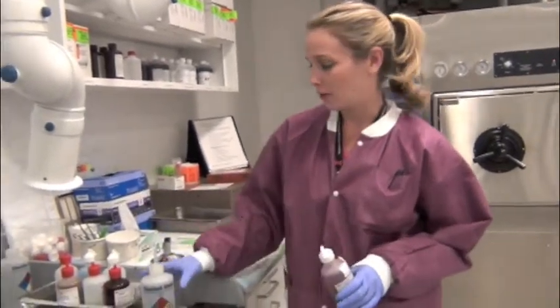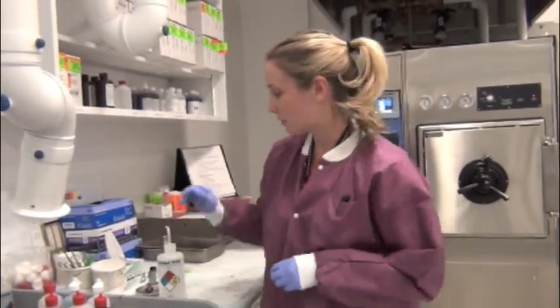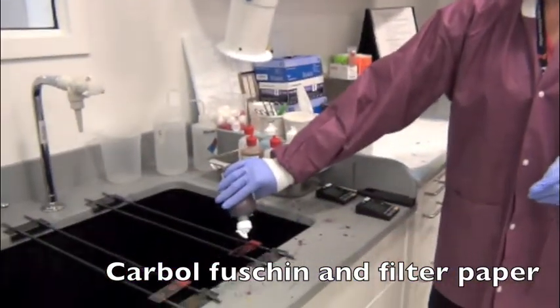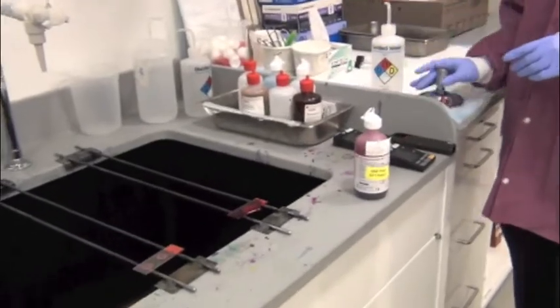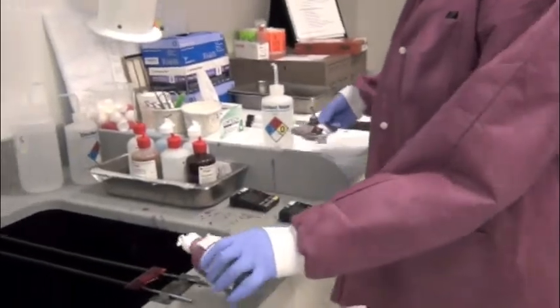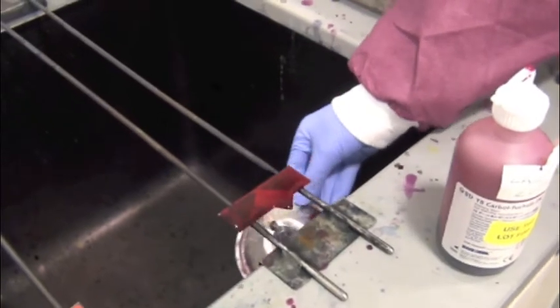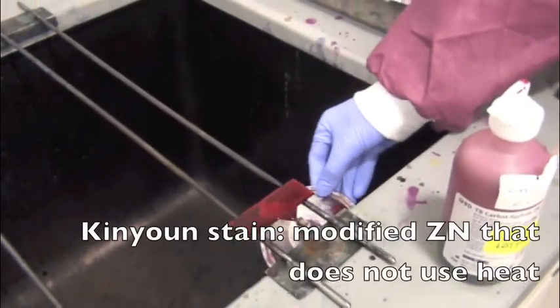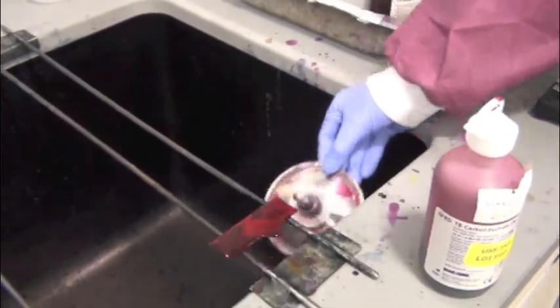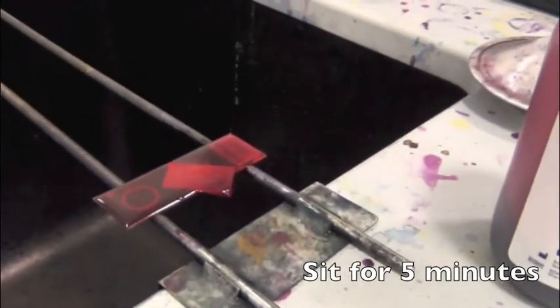Use carbolfuchsin and auramine. The first stain uses carbolfuchsin and it has to be heated up for at least 5 minutes. We also include a filter paper to get rid of all of the crystals that may appear when you heat carbolfuchsin. To start this stain, drench the slide with carbolfuchsin and then heat it lightly until it steams. Once the slide has started steaming, you let it sit for 5 minutes.